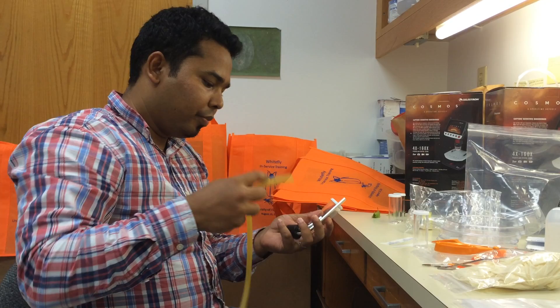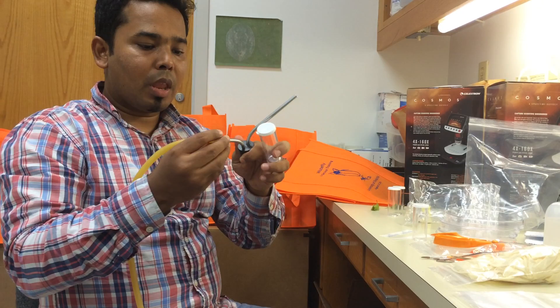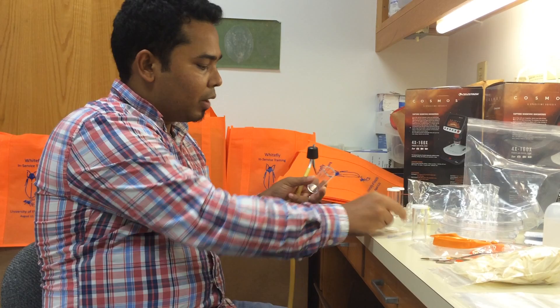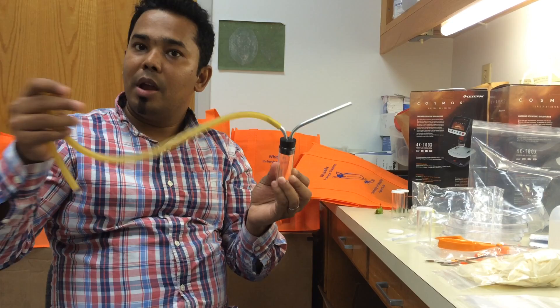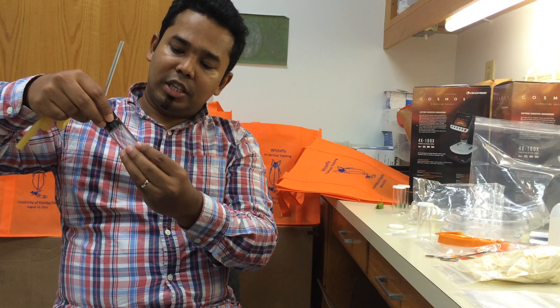You can connect this hose with this tube. At the end it has a filter. Then remove the cap of this vial and connect this vial with the aspirator at its bottom. The aspirator has three parts: one is a rubber hose, another is the collecting tube, and the third is this vial.